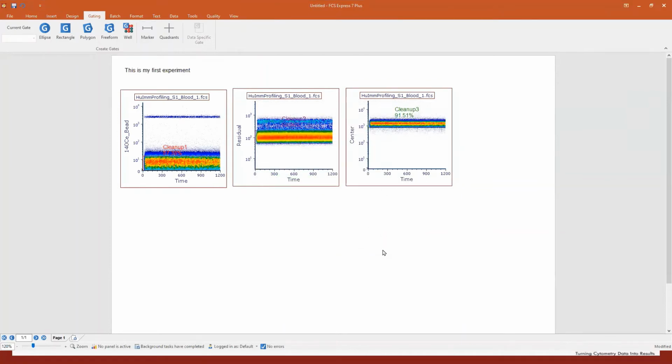Drag and drop in this case is an example of how to use drag and drop to create a new plot. But you can do a lot of stuff with drag and drop. We will see this also later on. But what I want to show you is that it's really easy to use. It's user-friendly. The PowerPoint-like interface allows you to feel yourself in a user-friendly and very familiar environment. You don't need to learn everything from scratch.